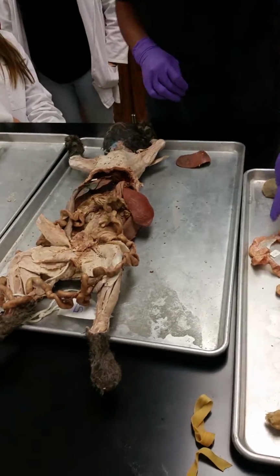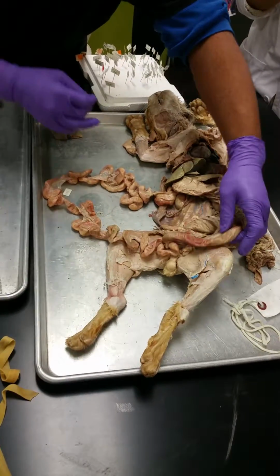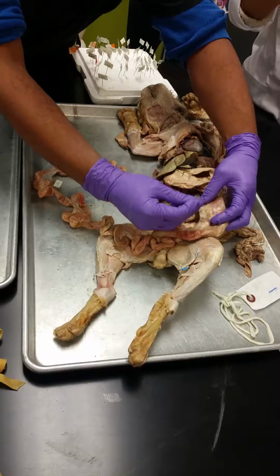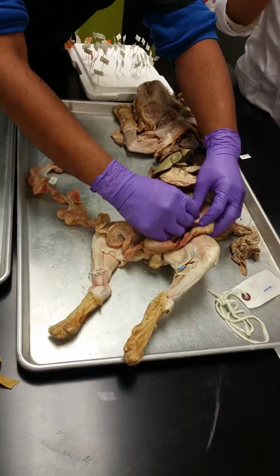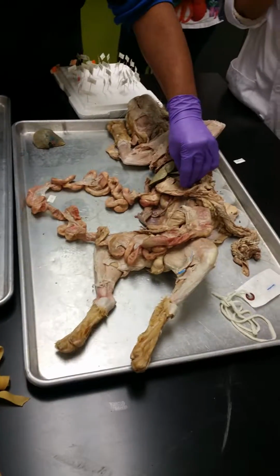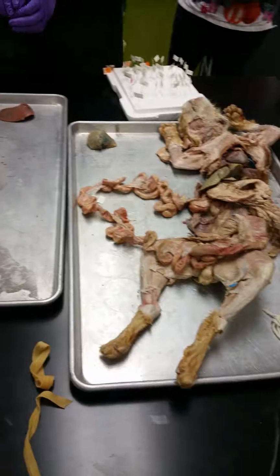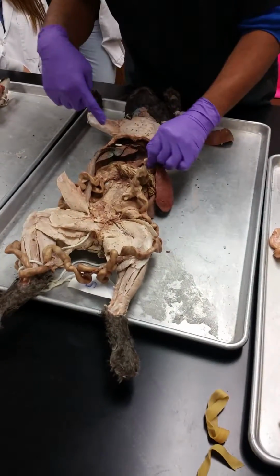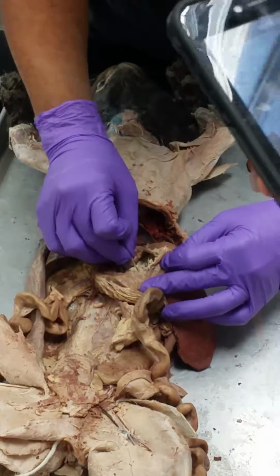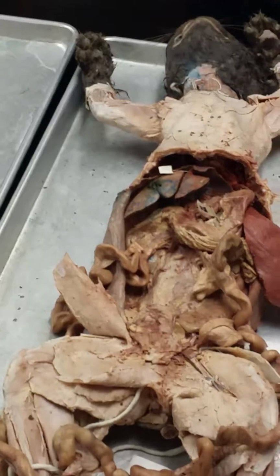Or 5. Mesocolon. All right, same idea, but for the large intestines. And the membrane that's hanging off of the large intestines right there. So that's the mesocolon. Stomach. The stomach, right there. Rugae. And this is our 7, so who had some good rugae? Yeah, the folds, this stomach has been cut open. And the ridges inside, those are rugae, the bumps inside of the stomach.